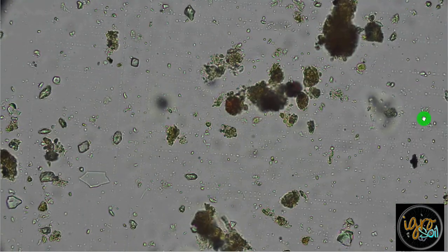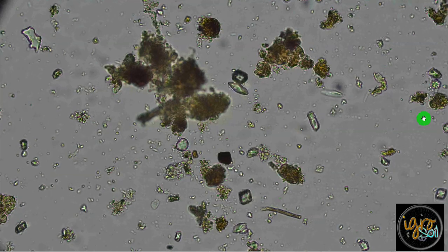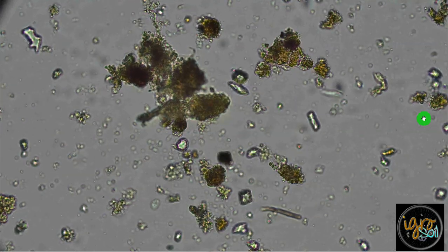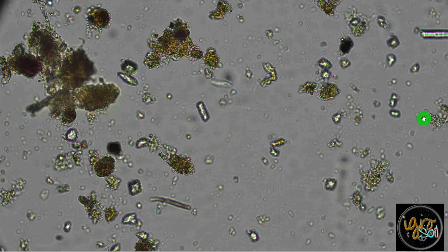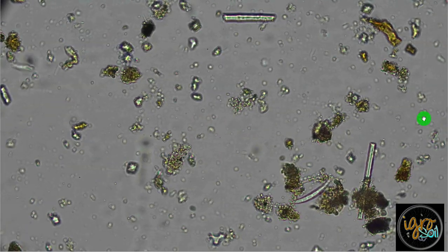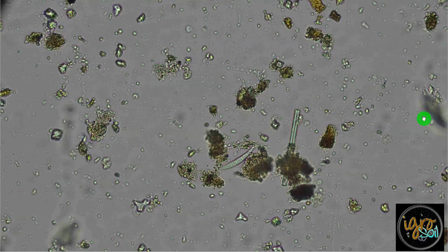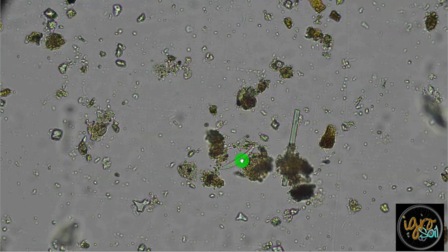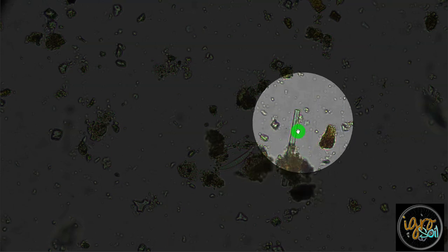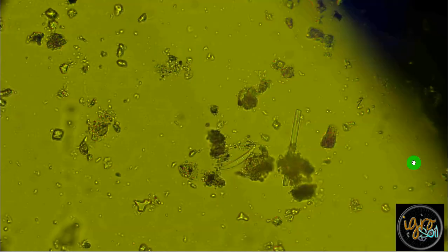So, I guess my advice to you is one, got to deal with that Fusarium. And by dealing with that Fusarium, you're going to get life. We need to put life in here to deal with the Fusarium. There's another one right there. So this is actually a fungus that I would have to even look to see what that might be. Let me put some lights on that.